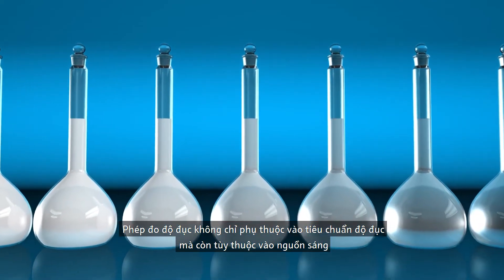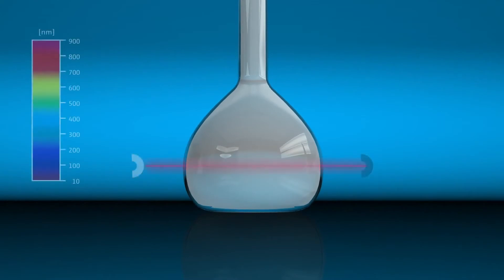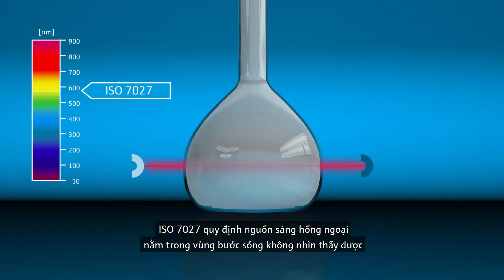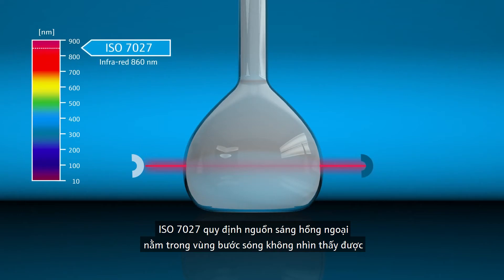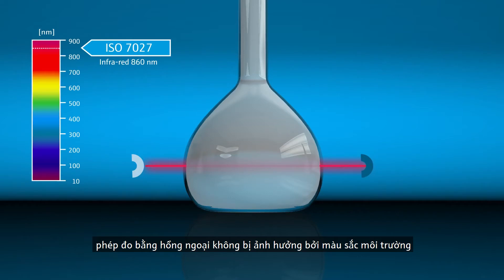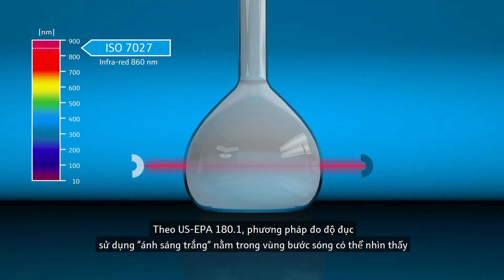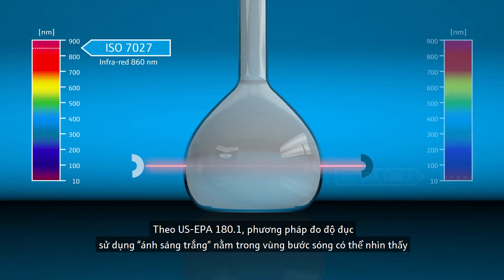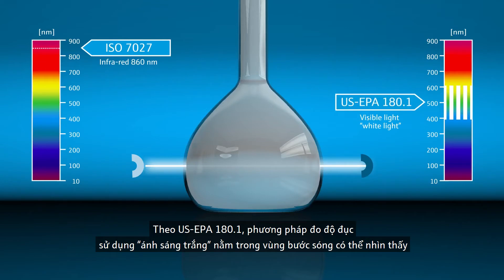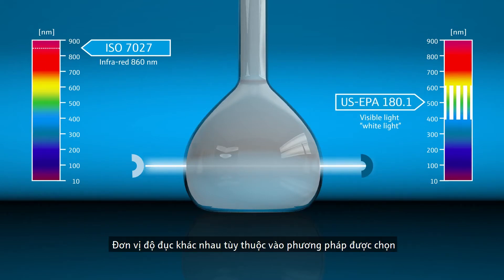Turbidity measurement not only depends on the turbidity standard but also on the light source. ISO 7027 stipulates an infrared source, which lies in the non-visible wavelength range. Since colors only occur in the visible range, the infrared measurement is not influenced by the medium's color. Turbidity measurement according to US EPA 180.1 uses white light in the visible range. The turbidity units differ depending on the selected method.